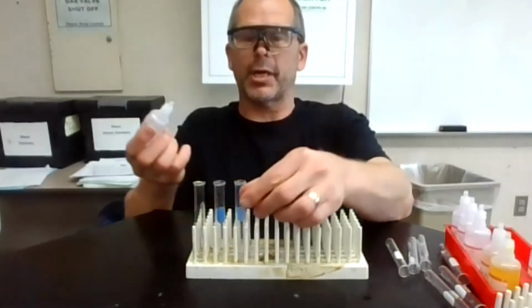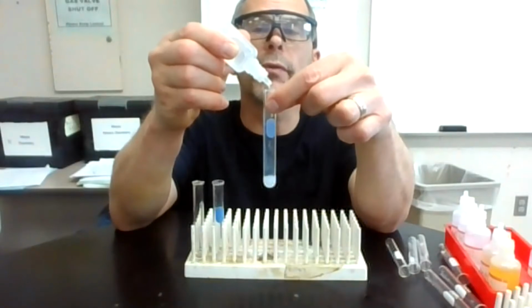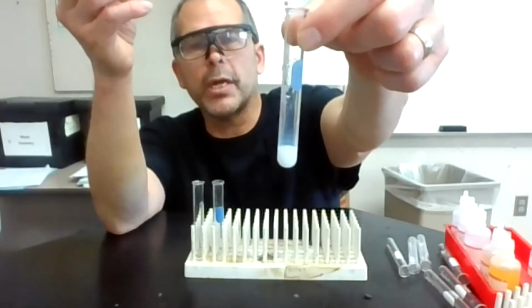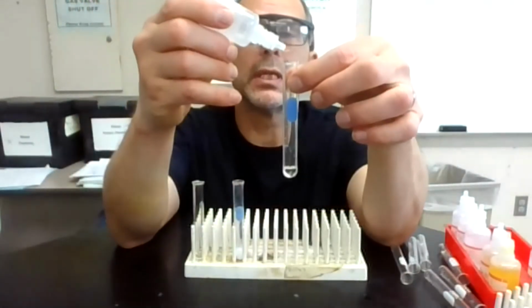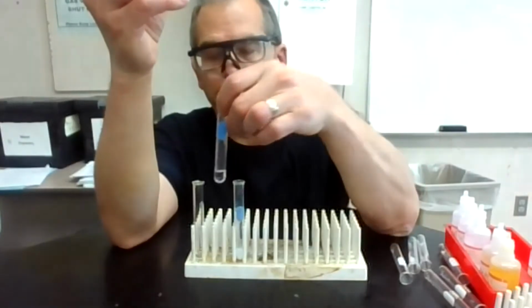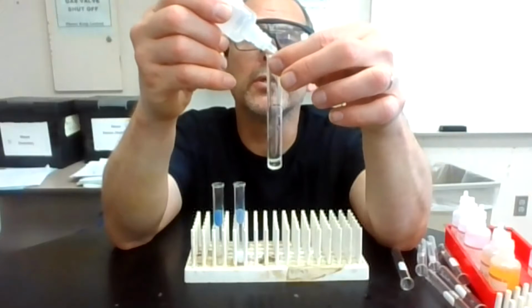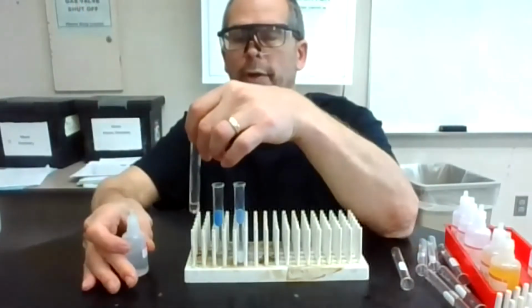Now I'm going to add 10 drops of Cl- to each one. So we'll watch with this. 1, 2, 3, 4, 5, 6, 7, 8, 9, 10. Okay, that looks all cloudy, and if I centrifuge that, it would probably get chunky. That was the silver. Now I'm going to do 10 drops here. This is the barium, looks like no reaction. And then I'm going to do 10 drops in the zinc. And that looks pretty clear, no reaction.